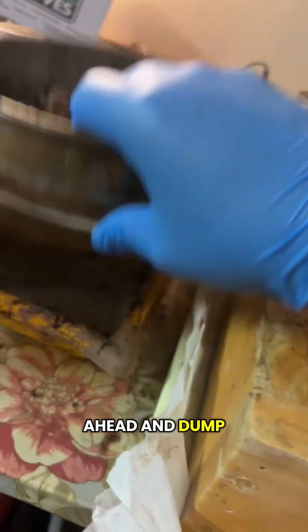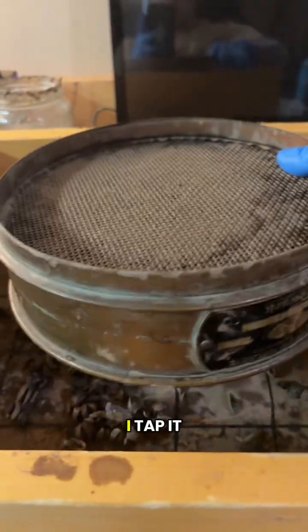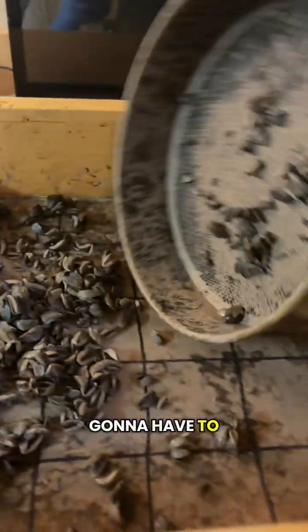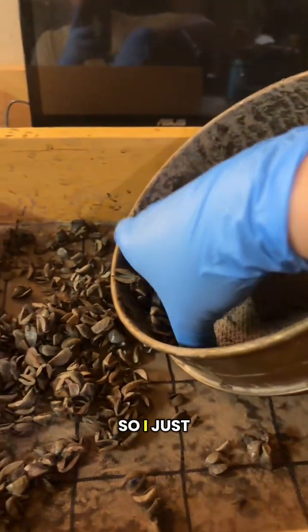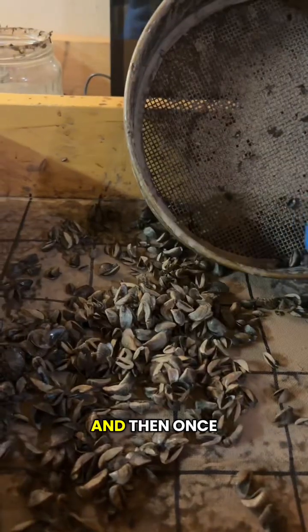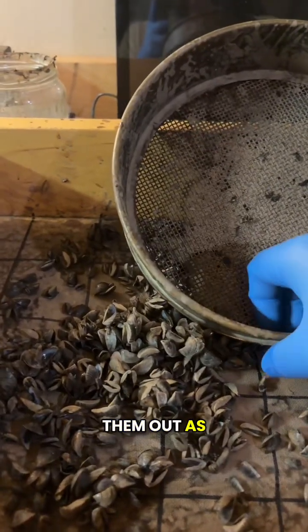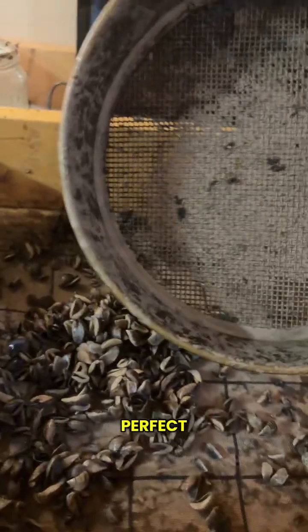So let's go ahead and dump these out. I tap it on the sides just to get them all like that. See, there's still some stuck in there, so then I'm gonna have to, it's hard to do with one hand. So I just scrape them all, do that. And then once I have them all in the tray, I'm gonna spread them out as evenly as I can just by eyeballing it. It doesn't have to be perfect.